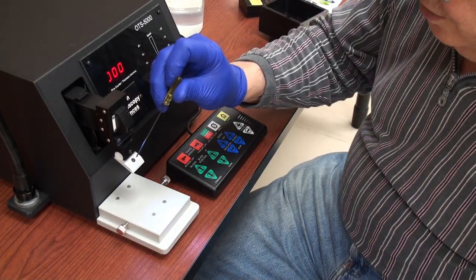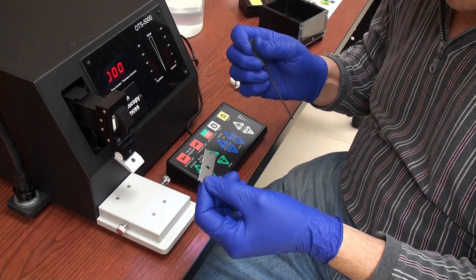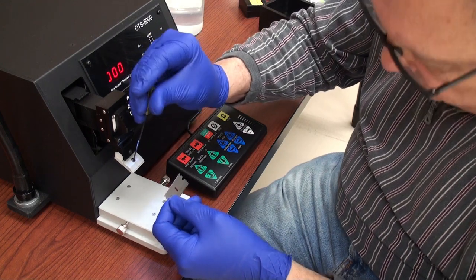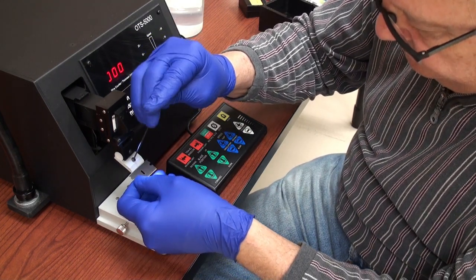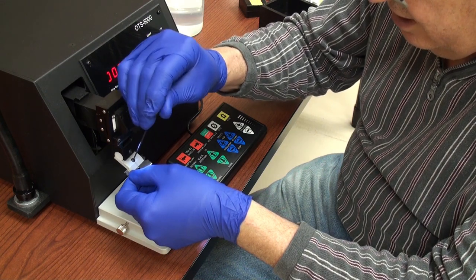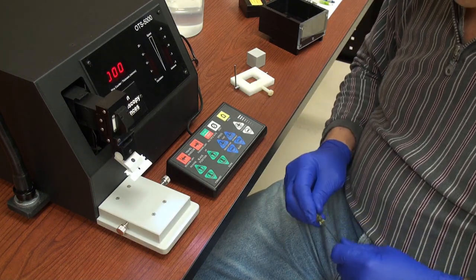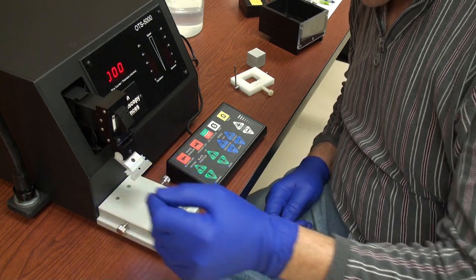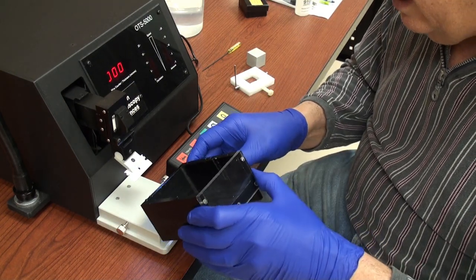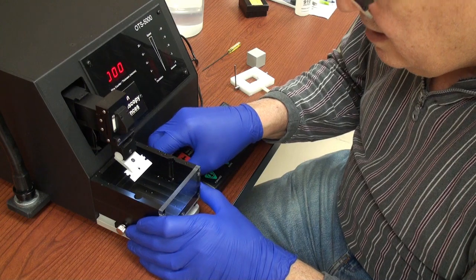The next thing I like to do is insert one of the razor blades or cutting edges that come with the system. These are sized so they fit in perfectly. There's a backstop which will allow you to position the knife perpendicular and lock it into place.